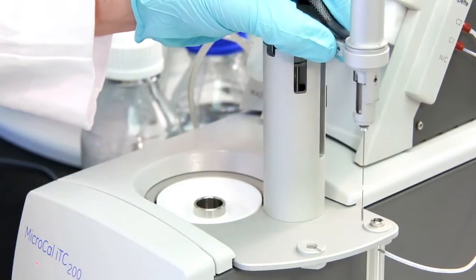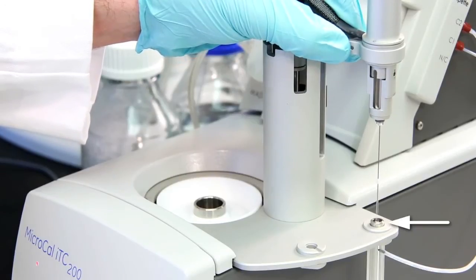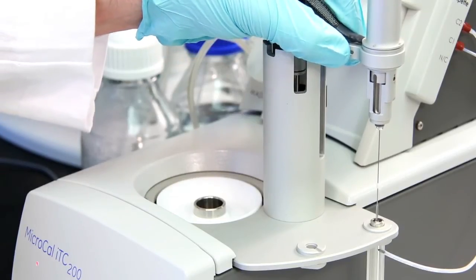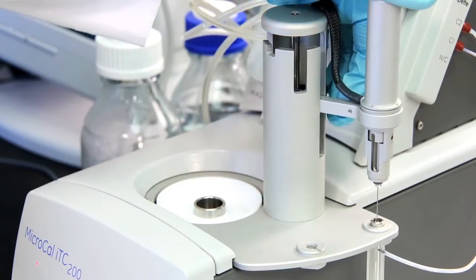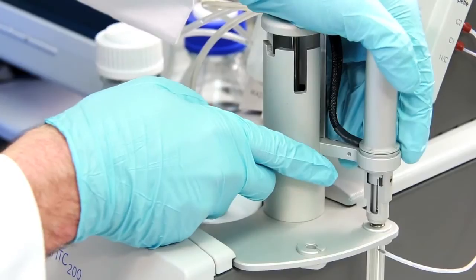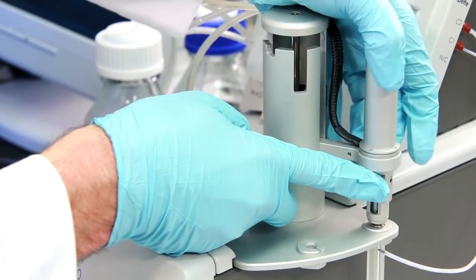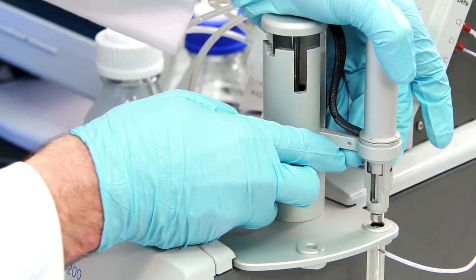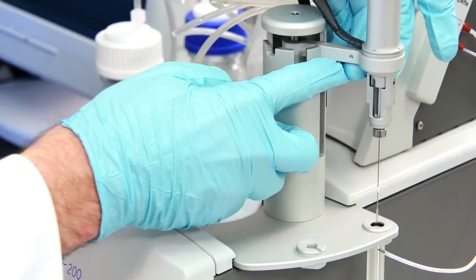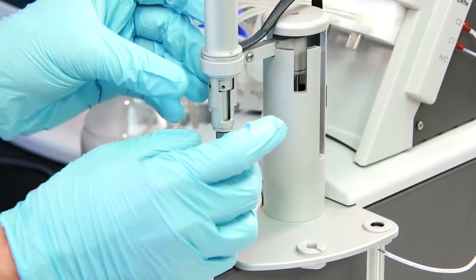Now rotate the pipette to the wash station where our securing nut is still in place. This keeps the nut aligned, wherein we can just drop the pipette into place over the securing nut and rotate the pipette a few times to engage the threads on the securing nut. Move the pipette to the rest location and finish securing the nut.